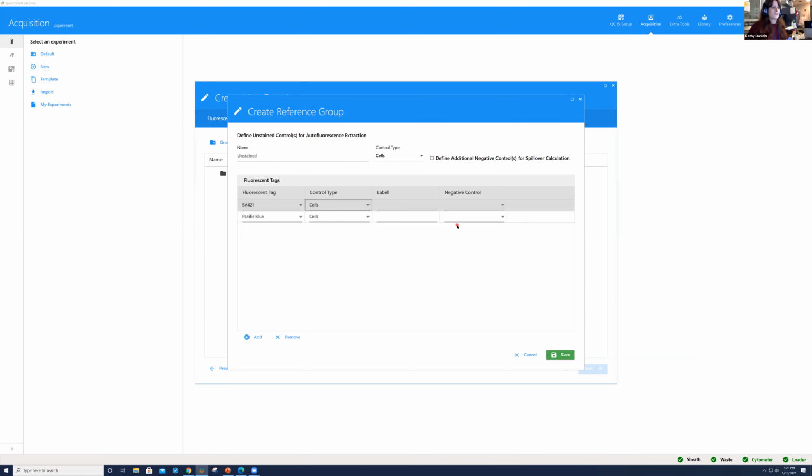And one thing that I prefer doing for the negative control, we have the option in spectral flow to set a negative gate as we're doing our unmixing to reference the negative population. But whenever I'm staining cells, so long as my unstained control is the same cell type, I would prefer to have this unstained sample as my negative control, because if you have an oversaturation of your antibody and you have your negative cells shifting up, whether it's with viability dye or antibody, it's no longer a true negative or a true unstained if you have background fluorescence. So that's my preference, okay?